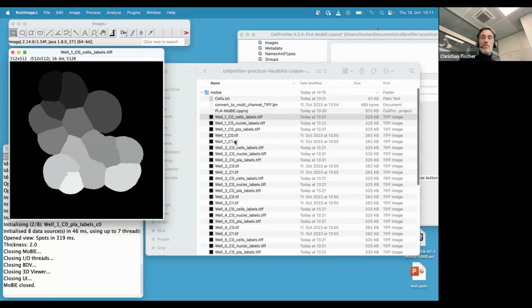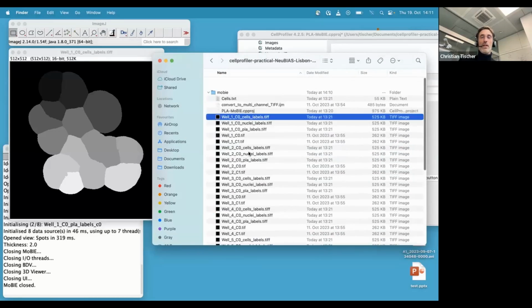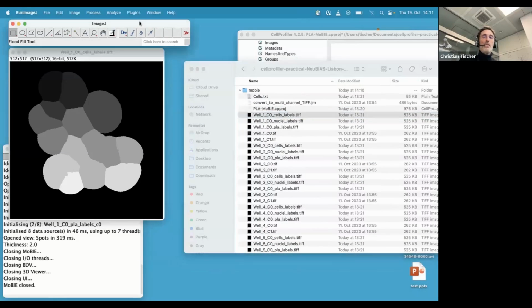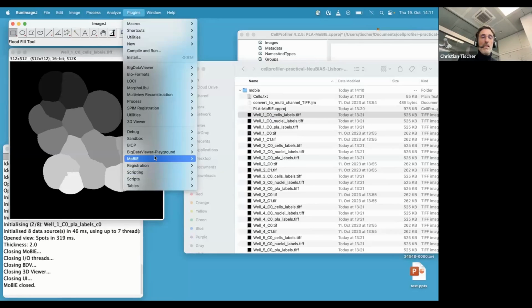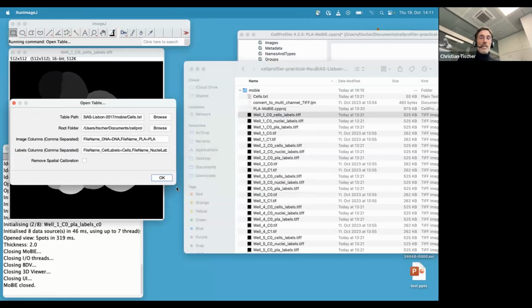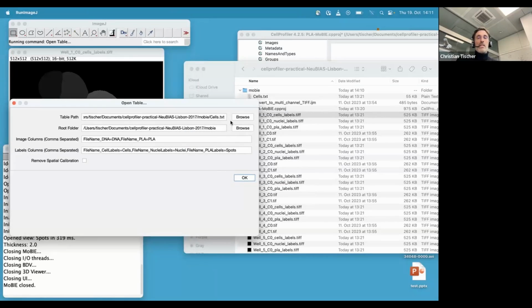So now, as mentioned, it's tedious to inspect all of them one by one, right? You could drag and drop, and that's what people do, all of them in Fiji, and then maybe look at it, does it make sense, and so on. But this doesn't really scale if you have like thousands of them. So that's why what you could do is, if you install the MoBIE update site, you can then say plugins, MoBIE, open, and you can open several things. Dominik will actually show you another way, but in this case, our entry point is a table.